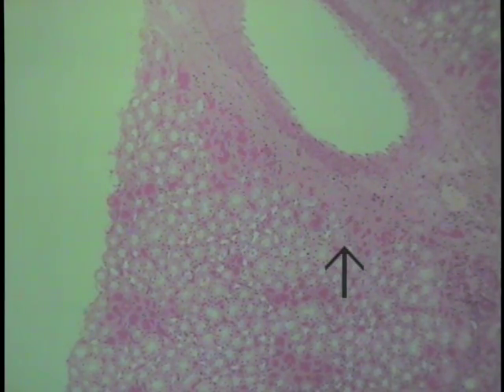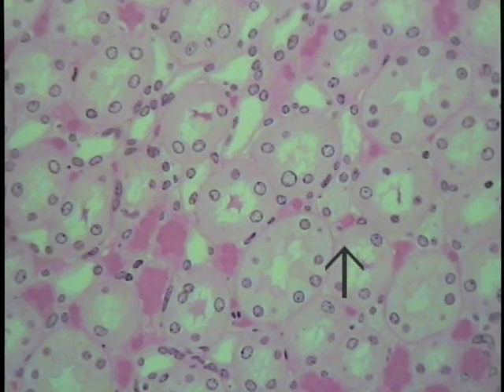One can compare the three types of simple epithelia. Do that at increased magnification. This is a region from the medulla of the kidney, showing you a comparison side by side of these epithelial tubes, and different regions of these epithelial tubes will be lined by a different form of epithelium.